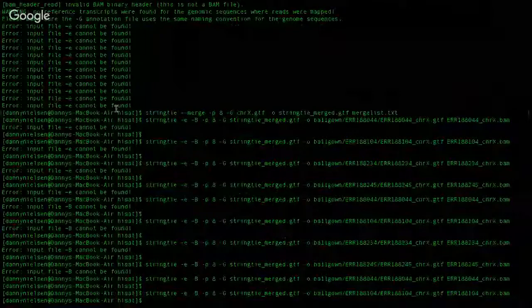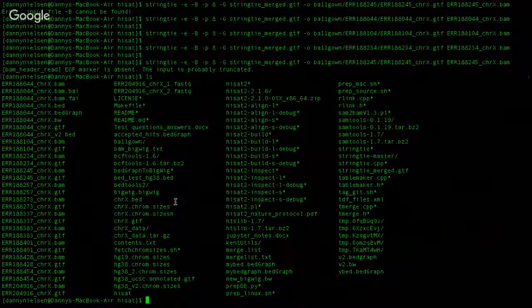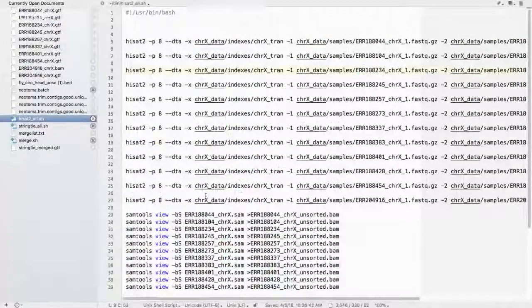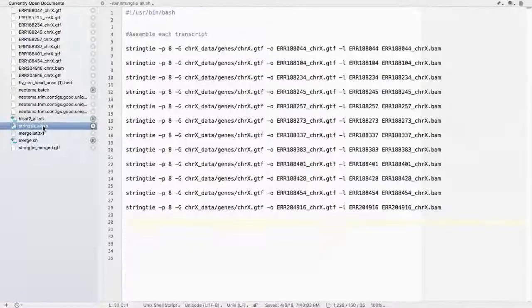So what I ended up doing, I'll show you, I've created the GTF files using StringTie and did some of the other work. What I did to speed this up was I created a series of bash scripts to do this. So the first step, I did HISAT2 and SAMtools. So I just entered in each line for every file. And then once I finished that command, and it took about 20 or 30 minutes, I did the next StringTie command. And this assembles each transcript.